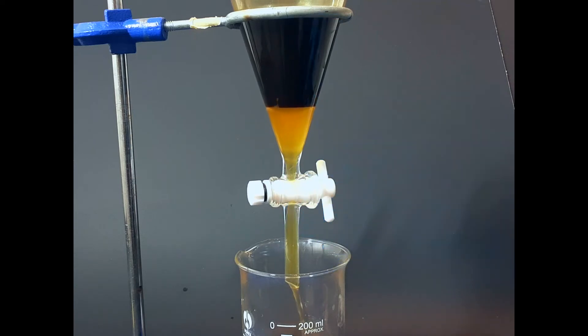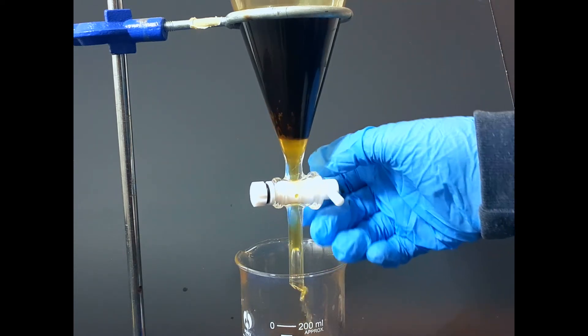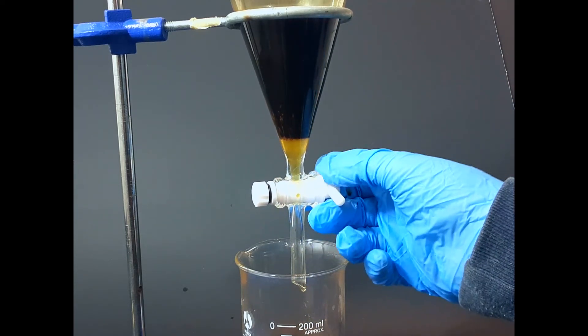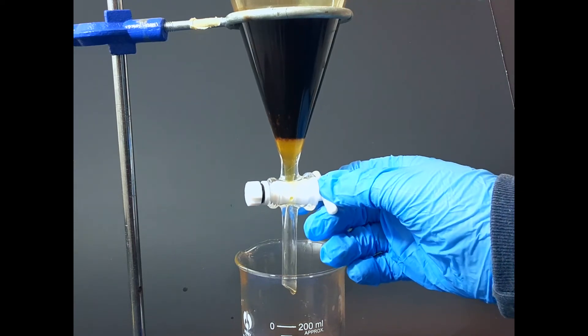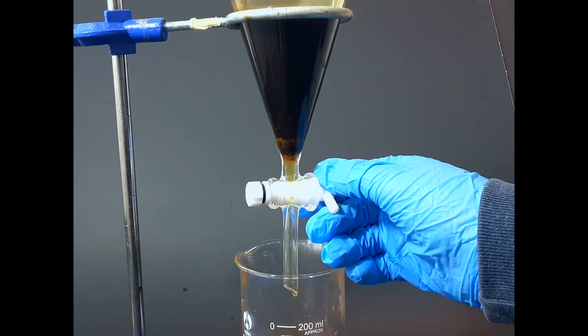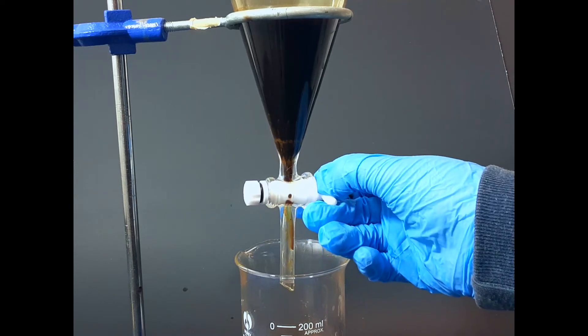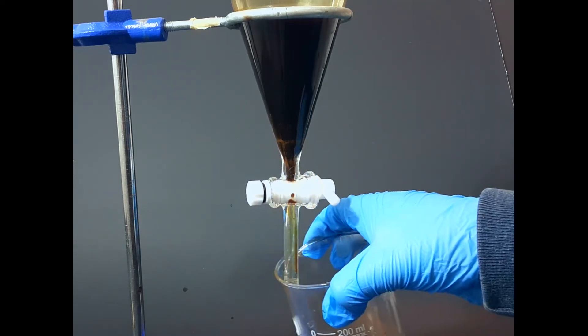I just poured everything out, making sure that I don't get any of the other coffee. I put it all out into a beaker. What I do with this is simply waste, and I don't really need to do anything with it.